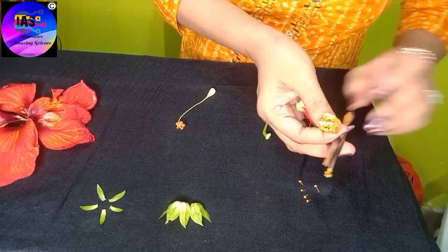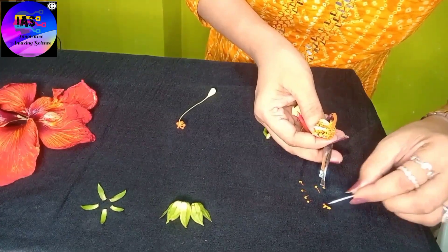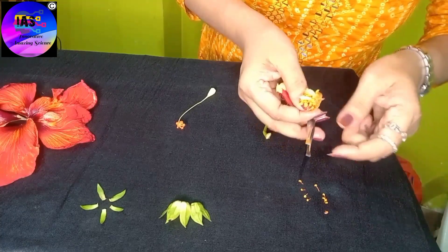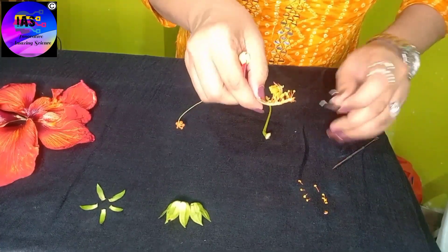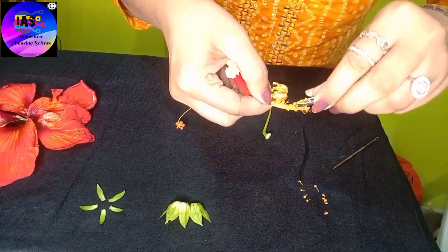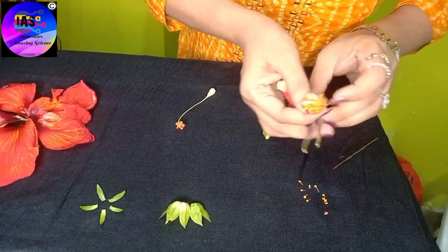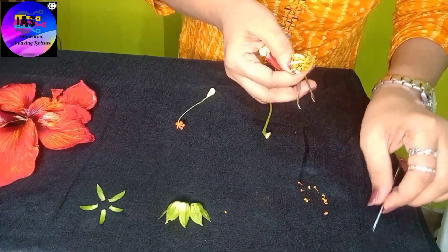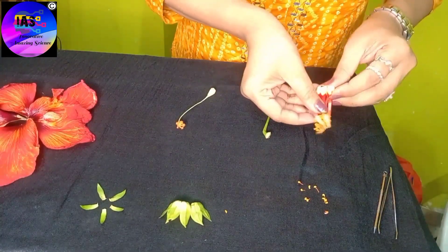This group of stamens together is known as the androecium. See how beautifully these stamens look. With the help of the tweezer, I'm trying to separate them — you have to be a little bit careful, otherwise the anther might fall off. Now here you can see all the parts of this flower.